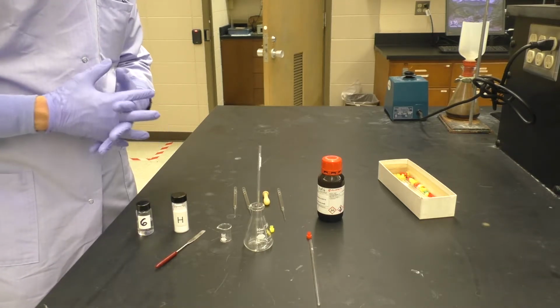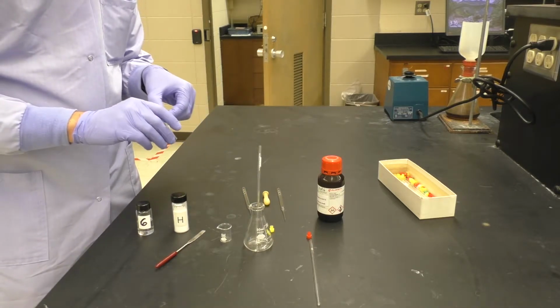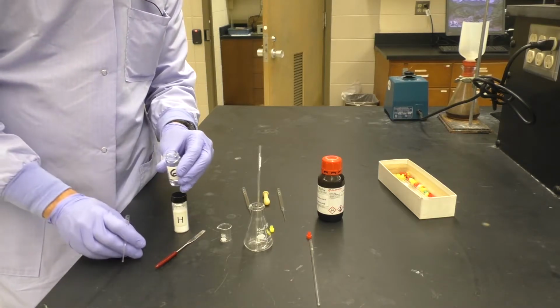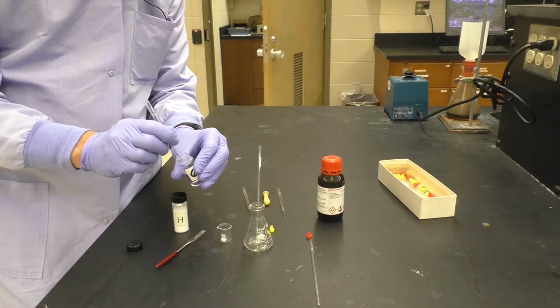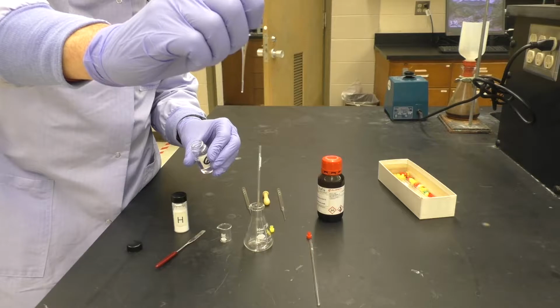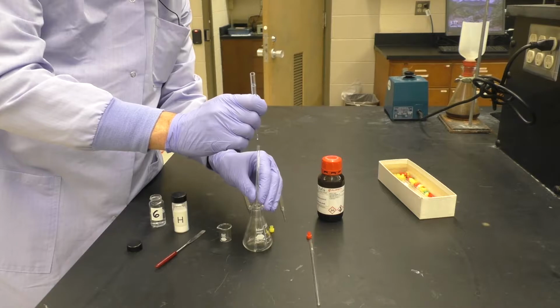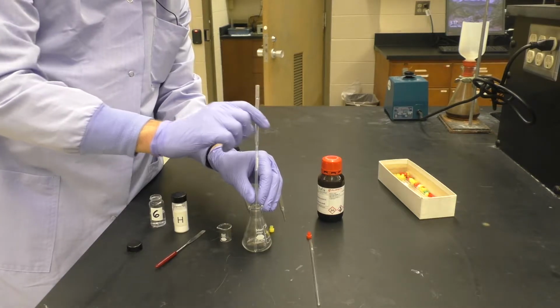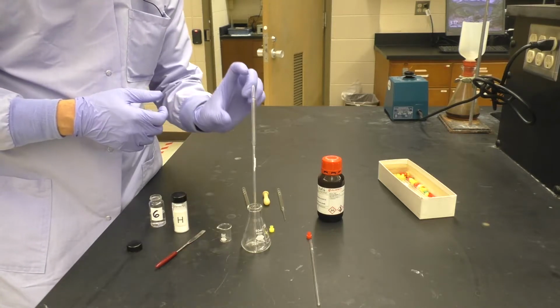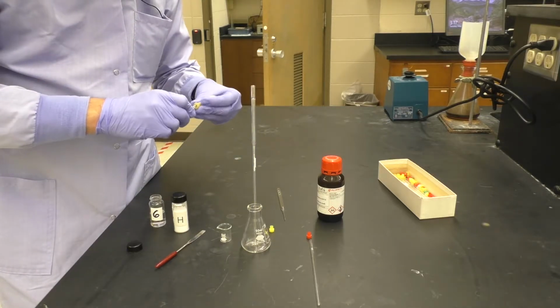Well, liquid sample preparation is very easy. It involves simply taking a pipette, taking the liquid that you wish to measure, and simply dipping the end of the pipette into the liquid. And by capillary action, you will pull up a certain amount into the end of the capillary. That is generally sufficient amount of material for an NMR analysis of a liquid, and so you place that then into the NMR tube.